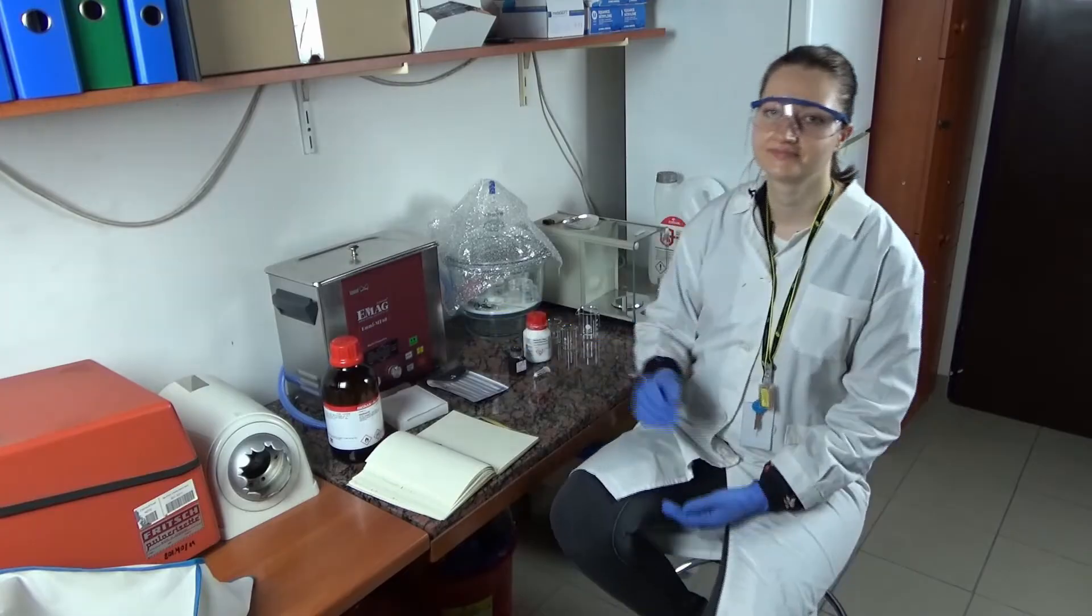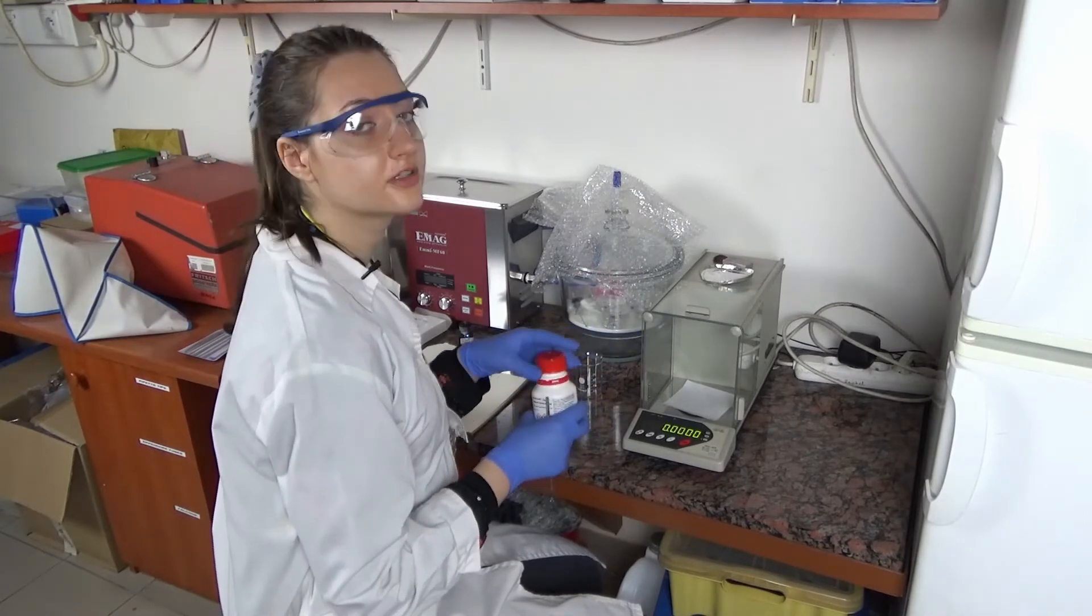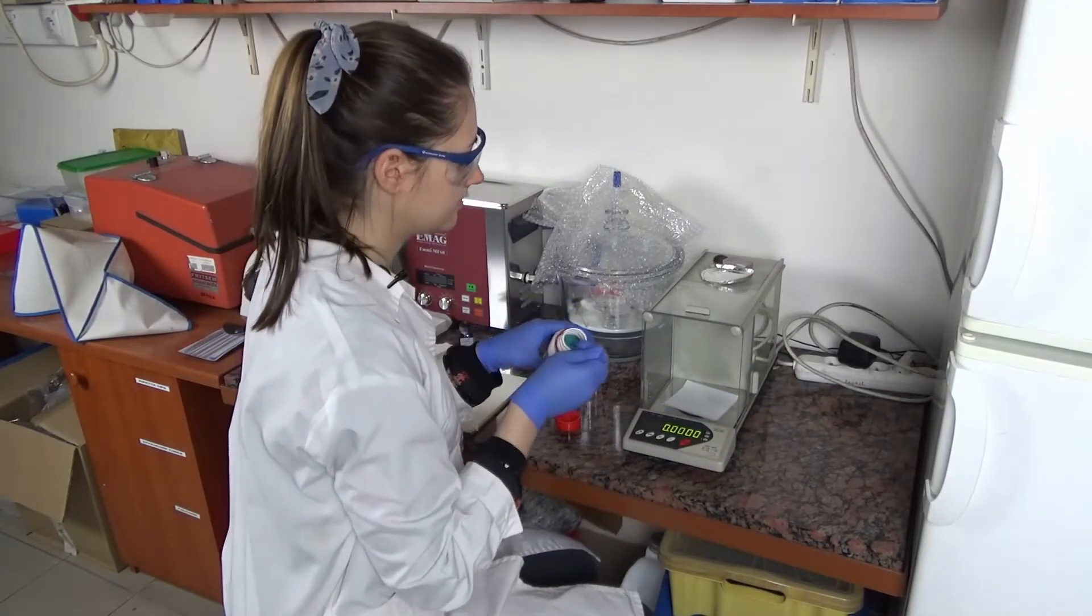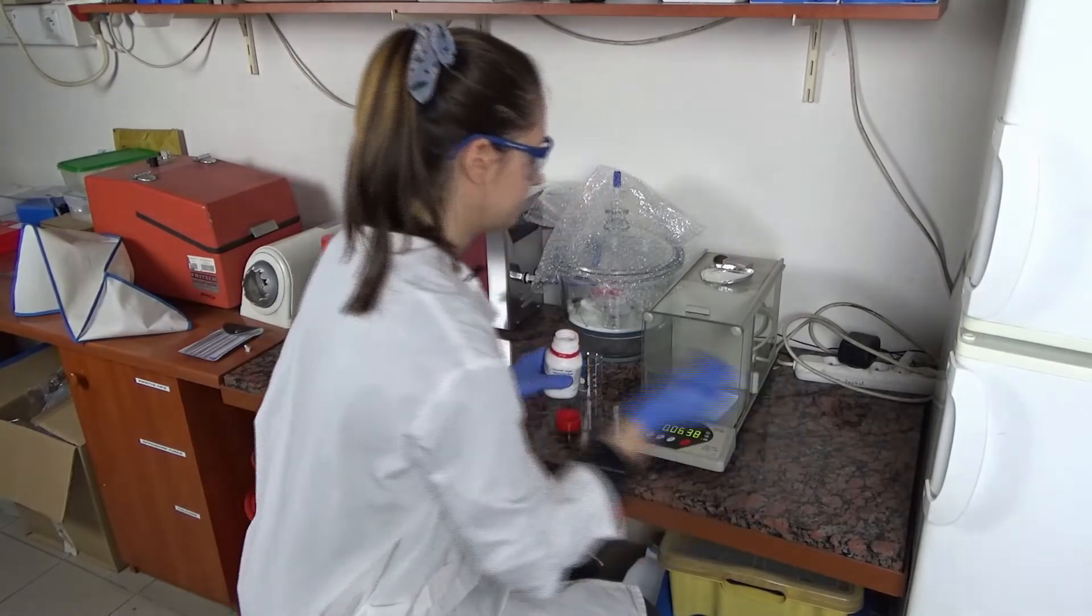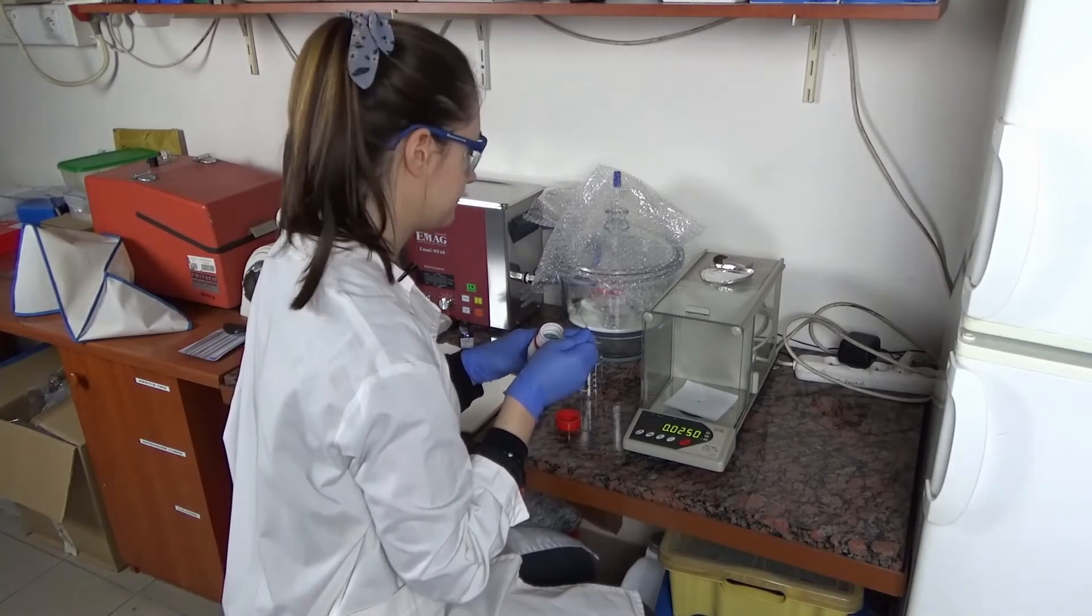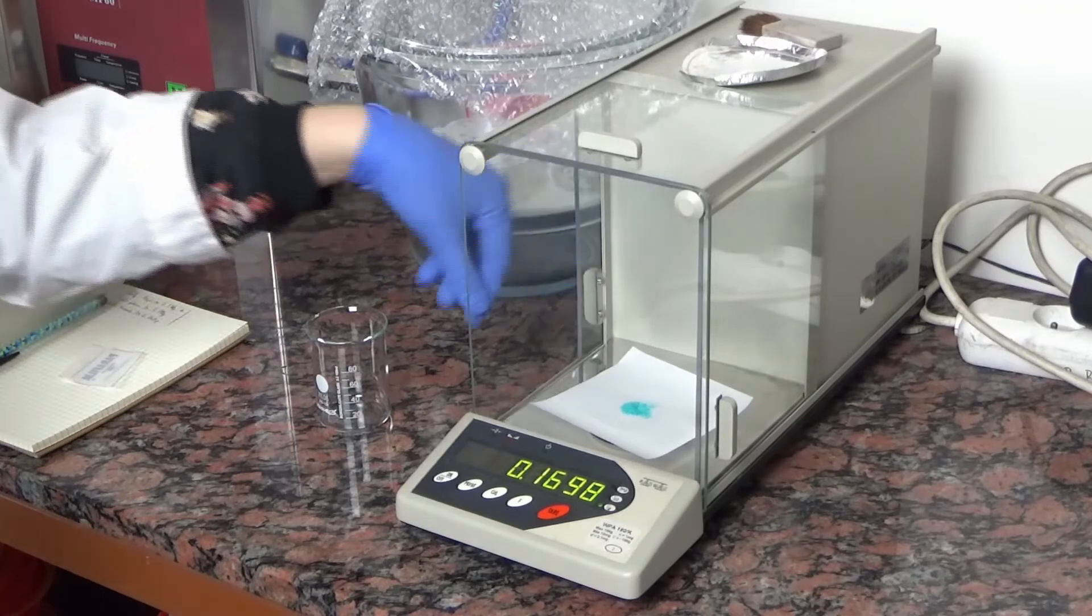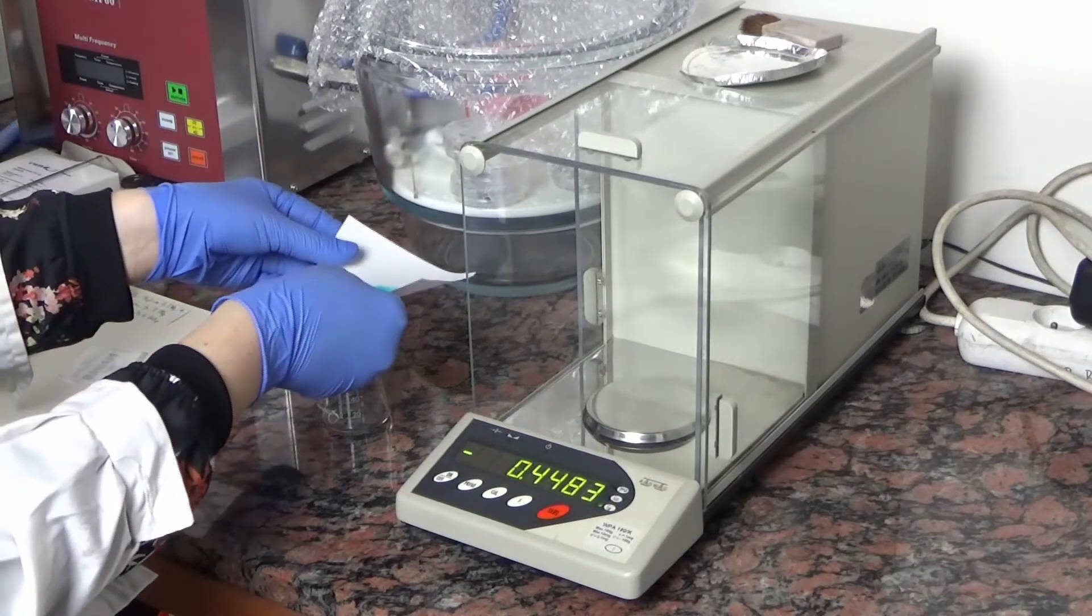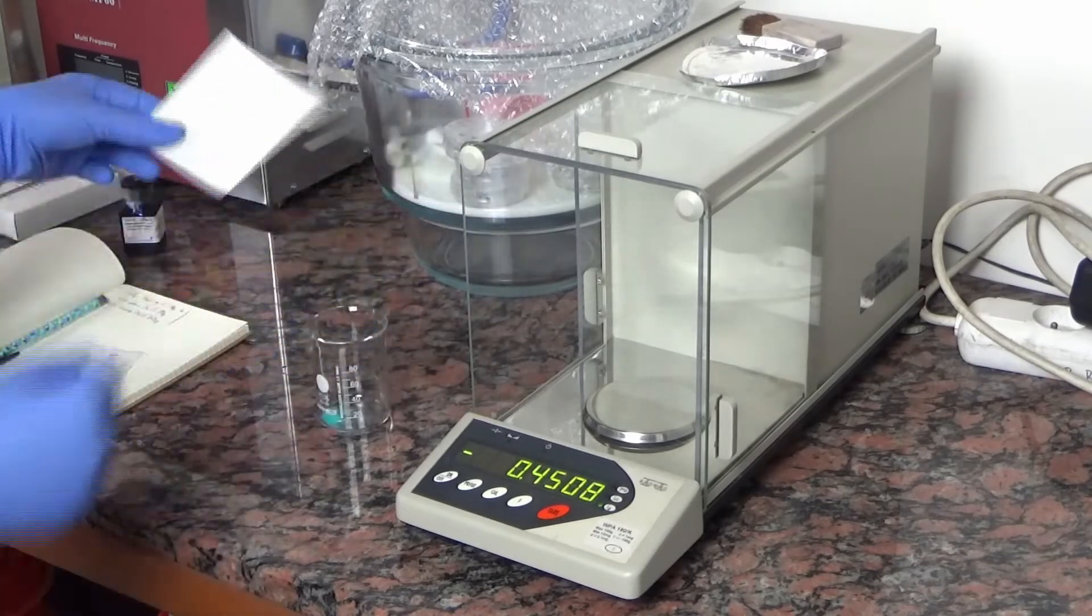Let's start the weighing. I'll start with weighing the first compound, that is copper chloride. Please remember to tare your scales before the weighing. It should be easy to weigh this compound because it is in the form of powder. Now I'll transfer this compound into our flasks. I have to do it very carefully, not to lose the sample.